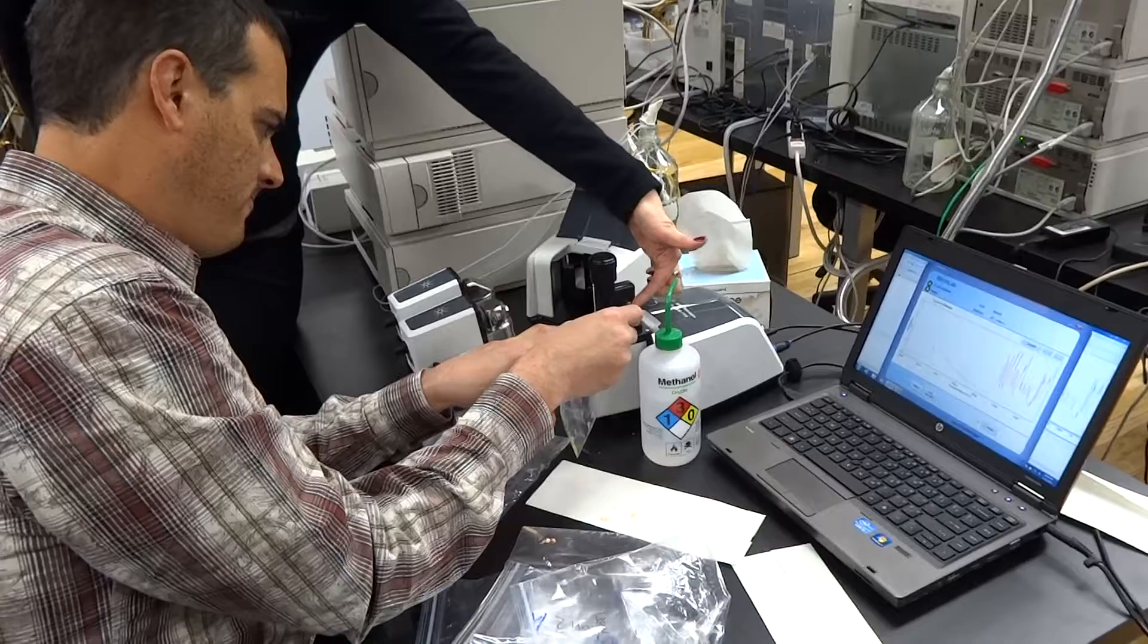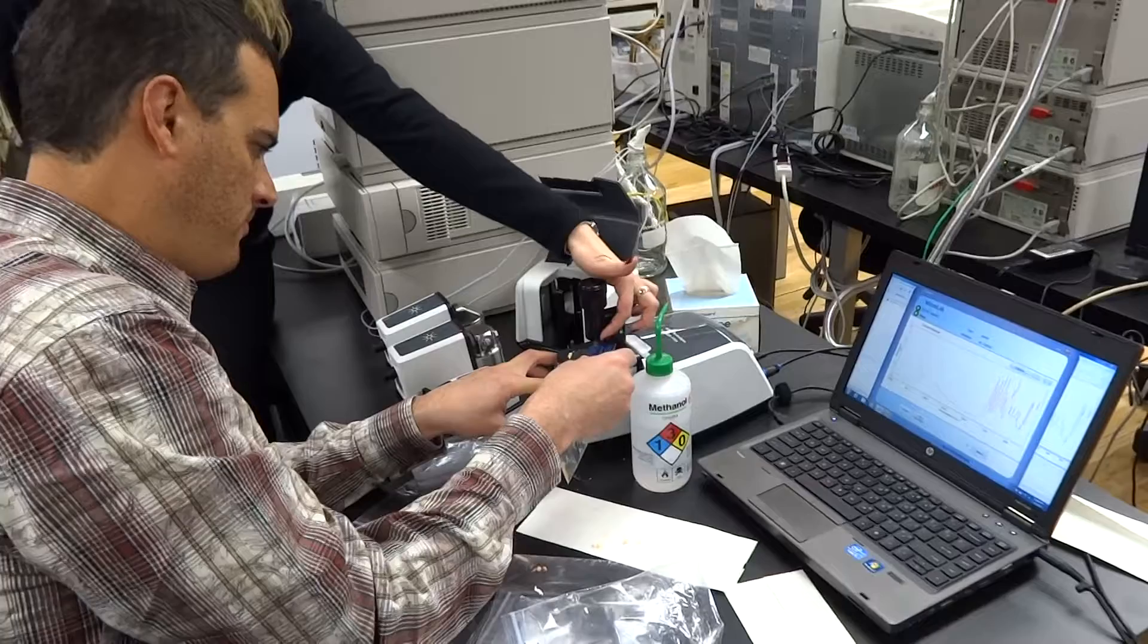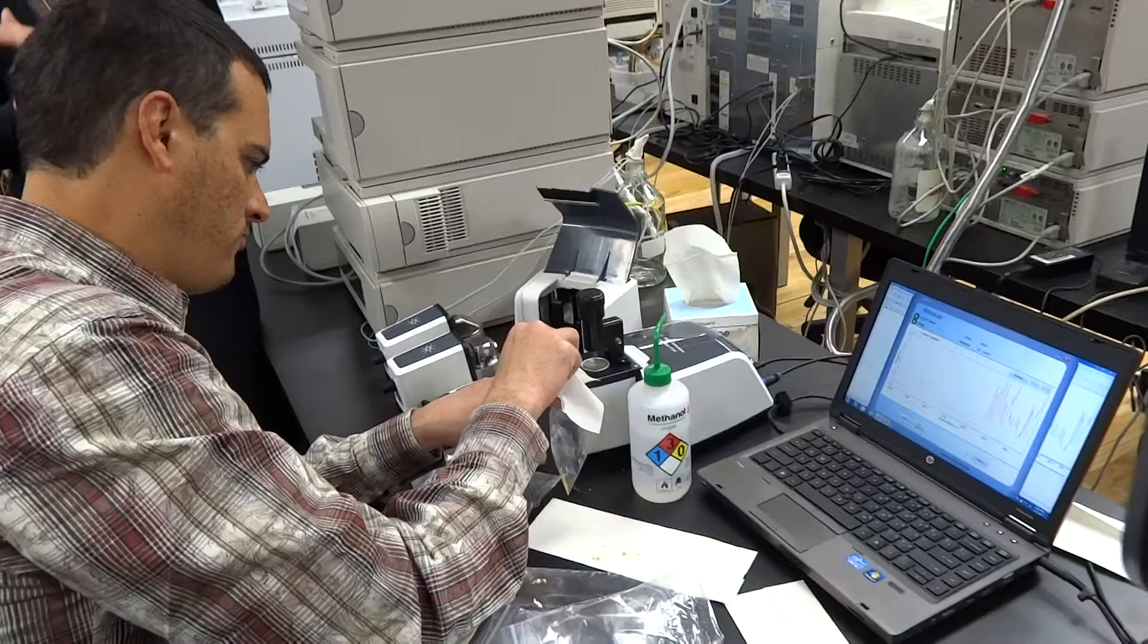There's another tip here to press. So you can change the tip. And because you want to make sure that the contact is... The better contact in FTIR, the better sensitivity it is. Because you crank it down. Because you get less noise.